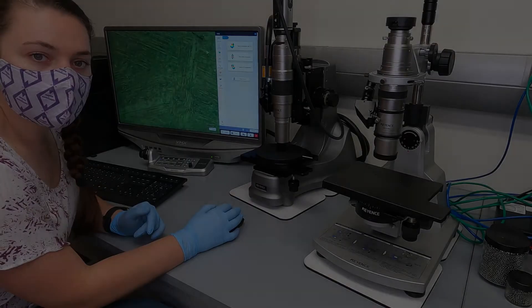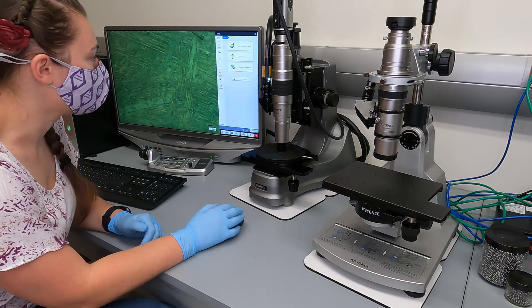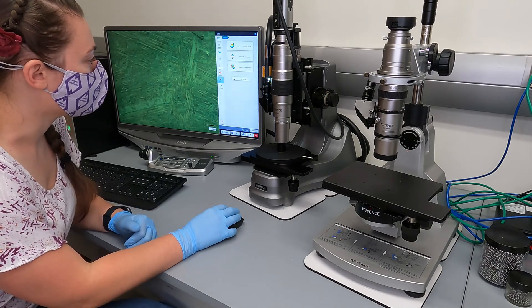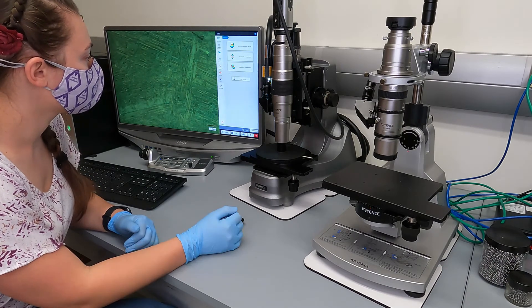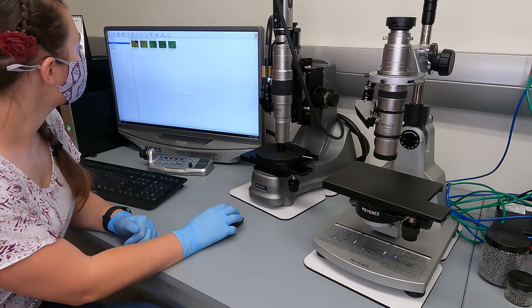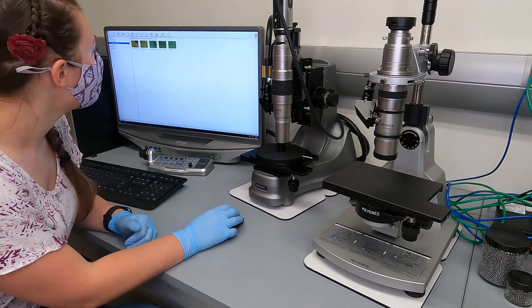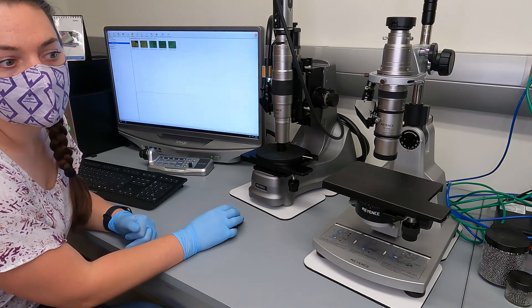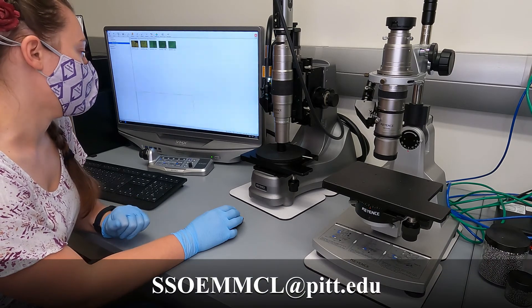That's a basic overview of the operation of the instrument. For your images, there's an album option — open the album window, find your files, and the system is connected to the internet so you can transfer files that way. It will also be connected to the MMCL server, so you'll be able to transfer images through the server as well.